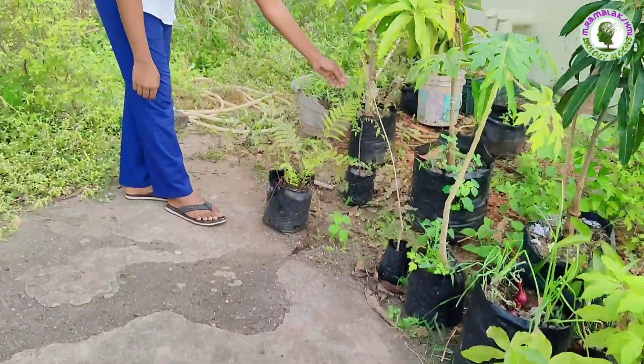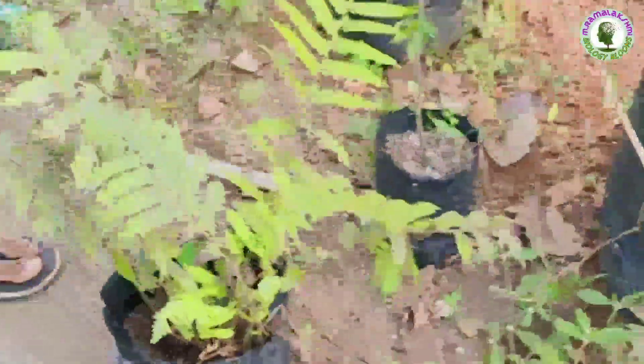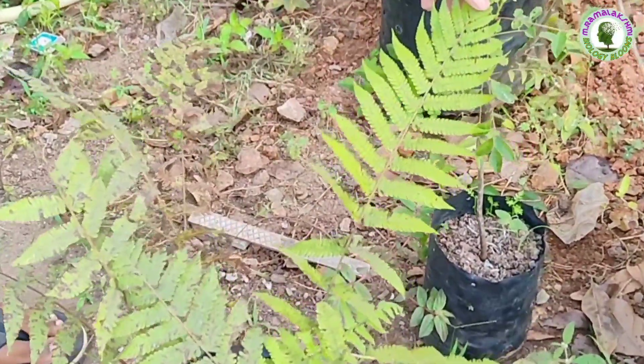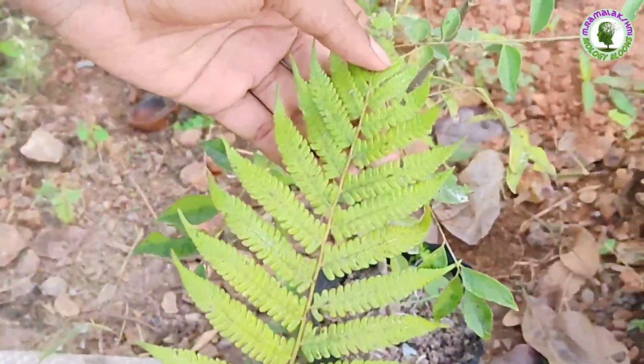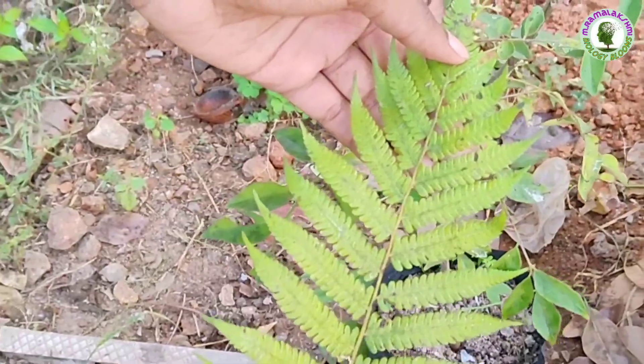Fern is a non-flowering plant that belongs to pteridophyta. It reproduces through spores. Its leaf is called a sporophyll.